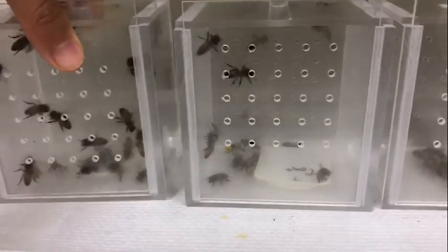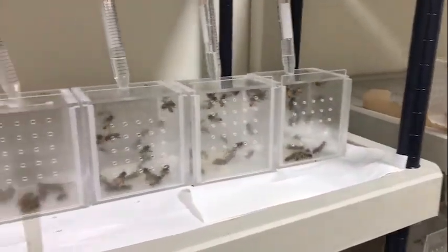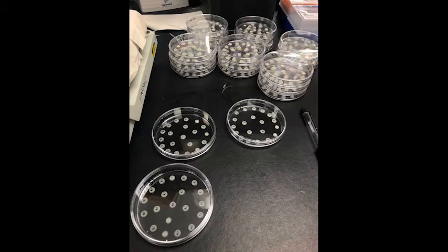Every day, we either go in and move the bees from here to a new dish with new blobs of food, or for some experiments, we can refill the blobs by just squirting a little bit more of the food in there with them. As long as they remain floating on it so that their side isn't covered, they can still breathe and develop normally. If they get totally covered in the food, the spiracles on the sides of their body, the holes that they breathe out of, can become blocked, and they'll die.